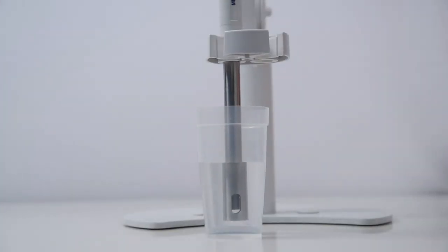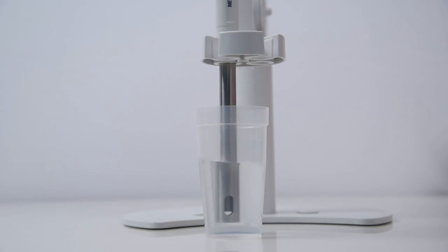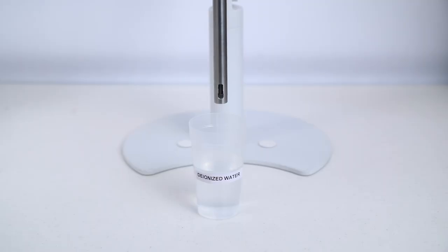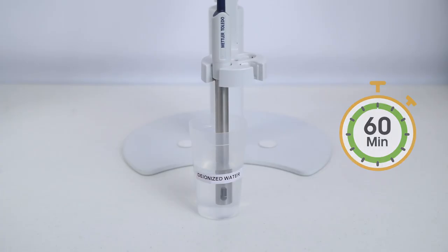Ensure that no air bubbles are trapped between the sensor poles by gently shaking the sensor prior to measuring and using stirring during the measurement. Condition the sensor in deionized water for one hour to ensure pole wetting.